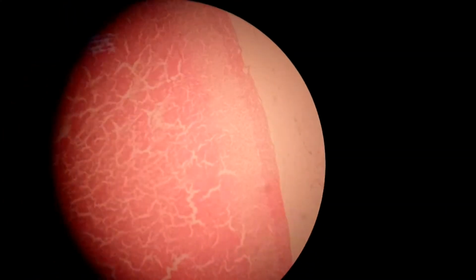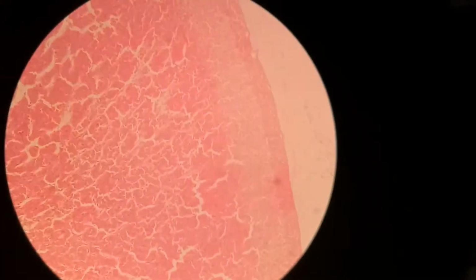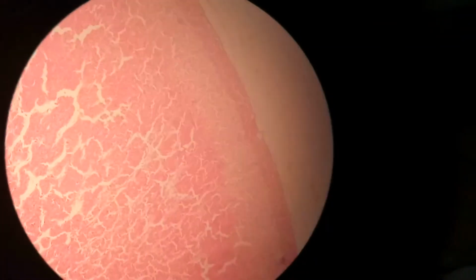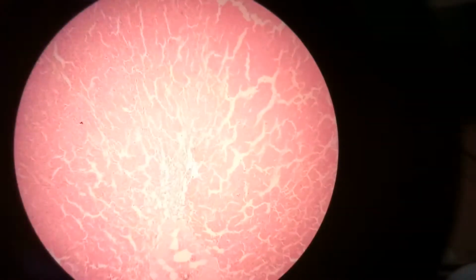Okay, the last slide is the slide of the adrenal gland, which is a pair of glands that secrete hormones directly into the bloodstream. The adrenal gland has two parts, which is the cortex, or the outer yellow layer. It takes its instruction from the pituitary hormone, ACTH. The hormones secreted here are called steroids and have three main types: those which control the balance of sodium and potassium in the body, those which raise the level of sugar in the blood, and sex hormones.